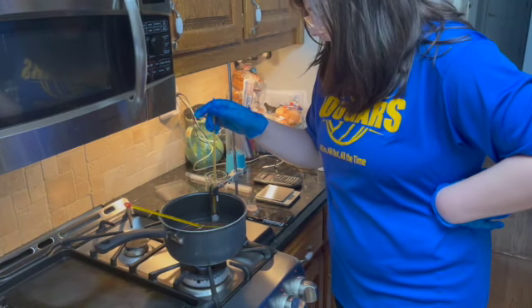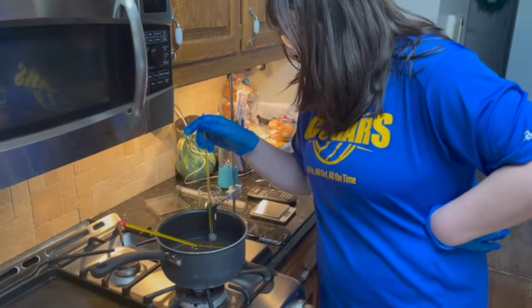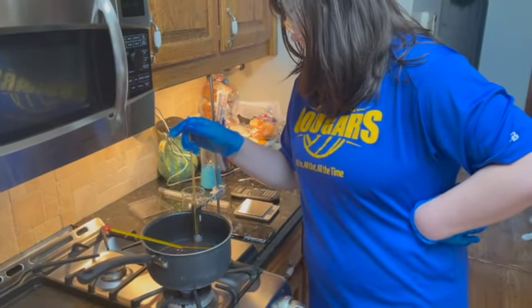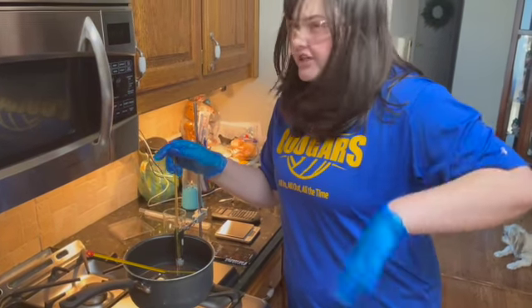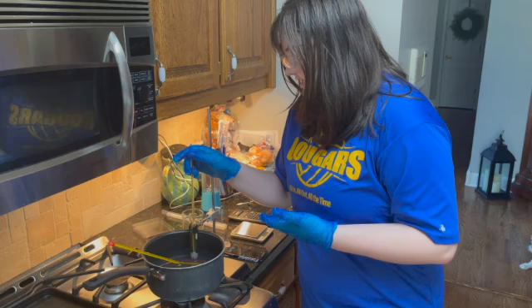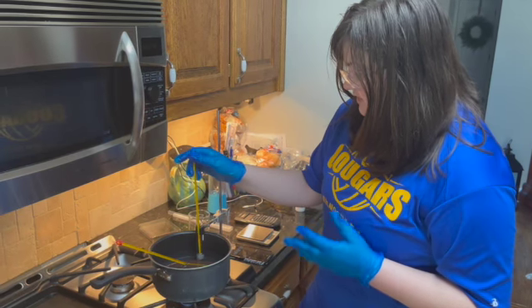So it seems like our solvent, as it is turning to a liquid, still has the same coloration, of course. It's still this white, almost clearish, it's hard to explain, but it's more like a cloudy white than it is a solid white for its liquid. So it's kind of in between that clear and that solid.